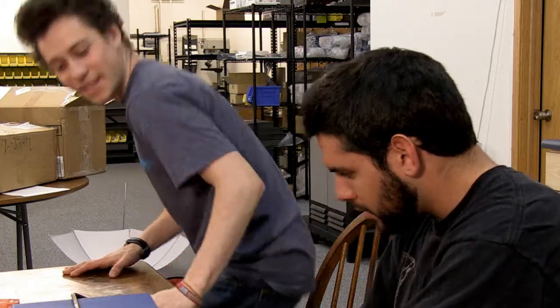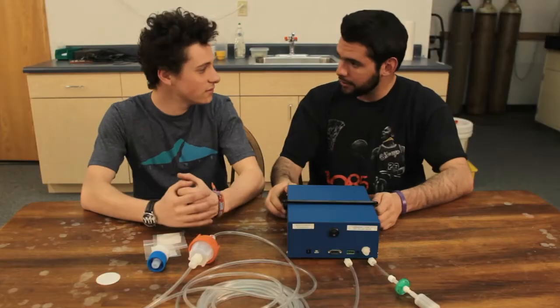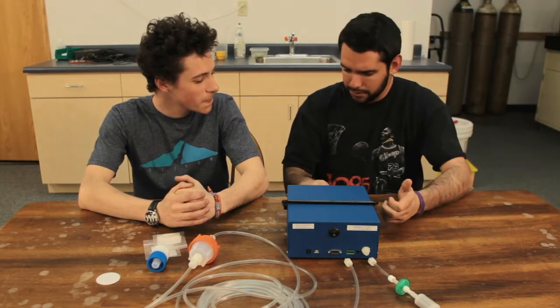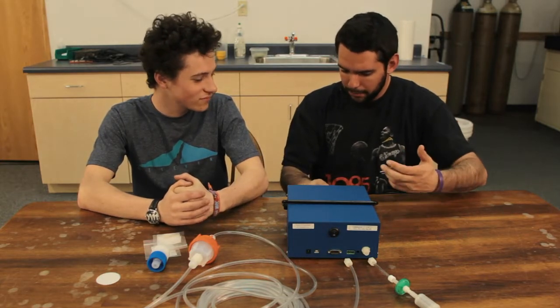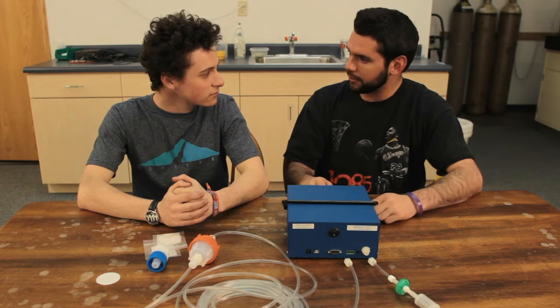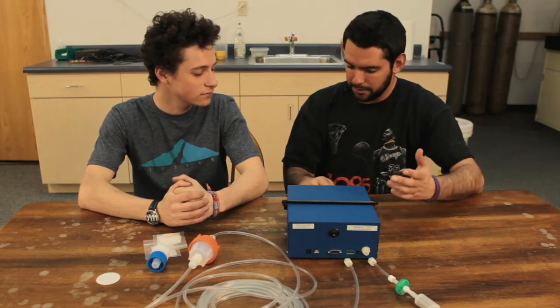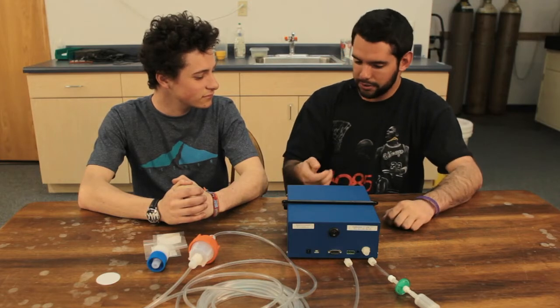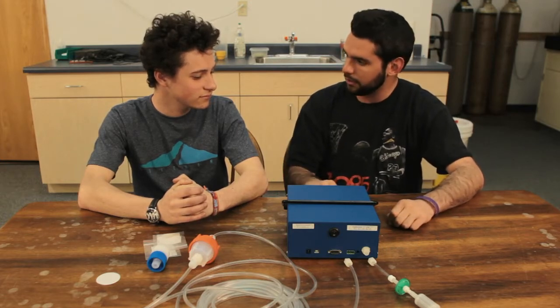Hey Cody, what seems to be the issue? Gary, I don't understand, man. This ozone monitor is just not doing what it's normally doing. I came back today and all my readings are just all over the place. They're bouncing back and forth between high and low, and I'm so confused and it's really frustrating. I've been sitting here for hours trying to figure out what to do.